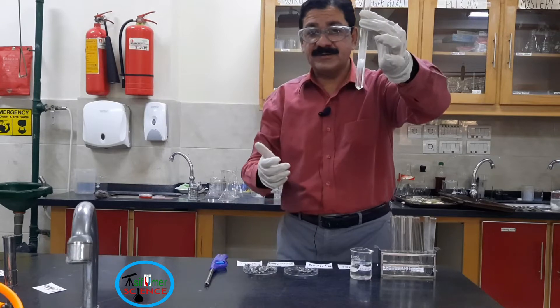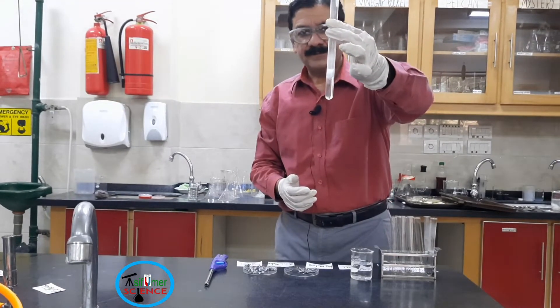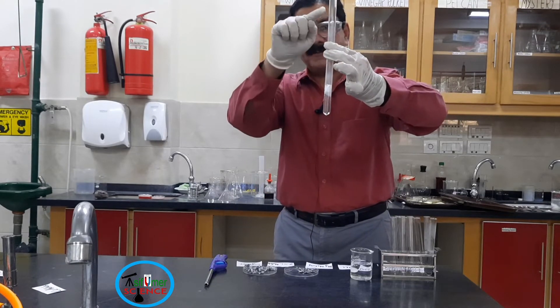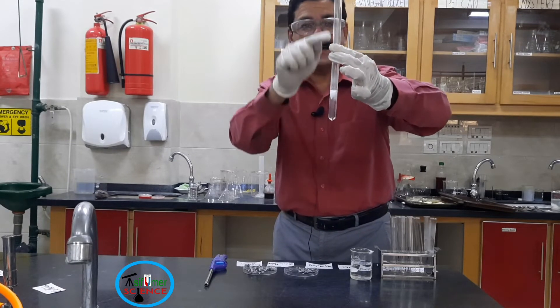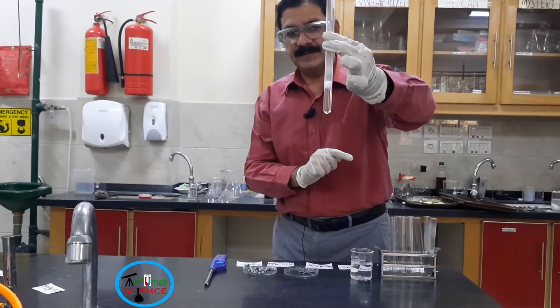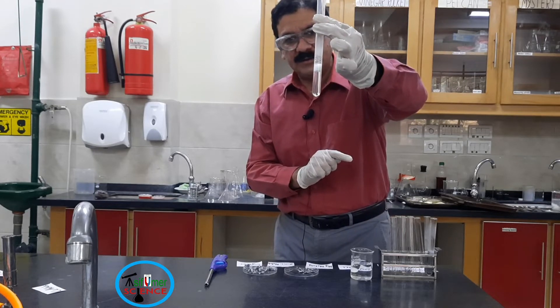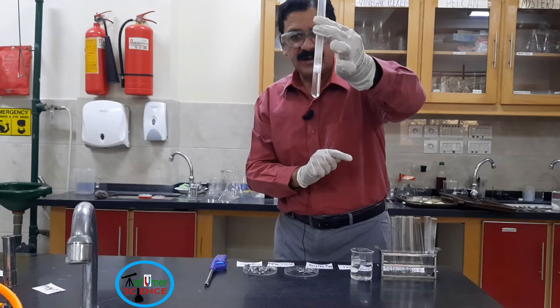Bubble production shows a chemical reaction is occurring. I am putting the test tube upside down here because I want to collect the gas in the upper part of the test tube. I think almost all of the magnesium ribbon has dissolved in the HCl.